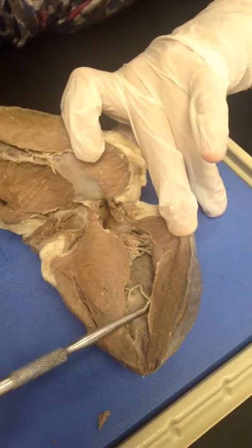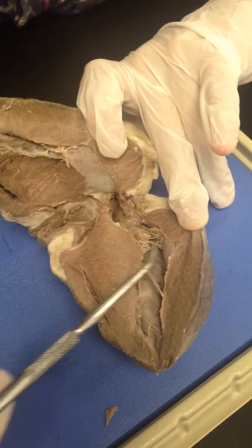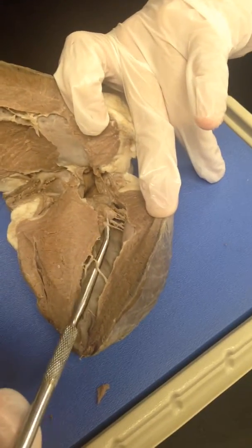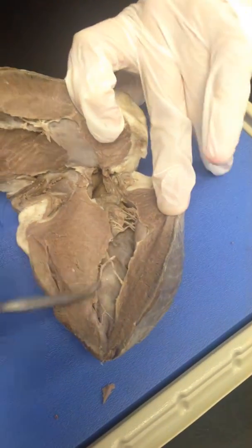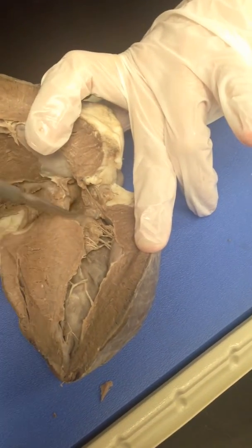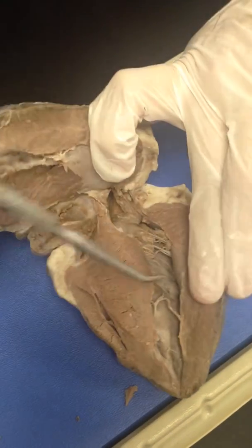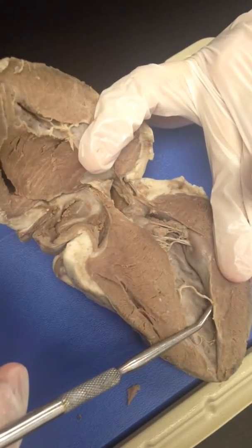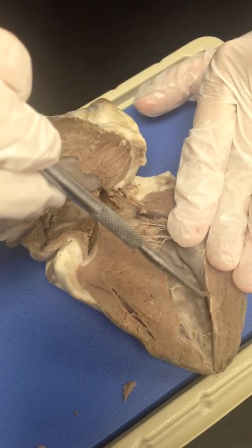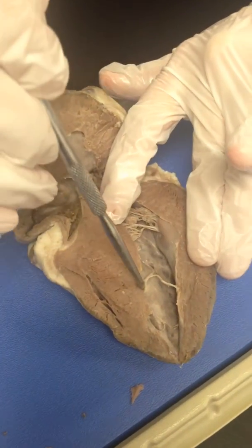And, oh, I forgot to mention, these are the chordae tendineae. These are cord-like structures that hold the valve together. You can see the valve right here. So it's held together by these chordae tendineae. It prevents it from flapping or going into the atrium, so the blood cannot go back. It is held through the ventricular side. It's held by the papillary muscles in the ventricular part, so you can see it right here, or right here.